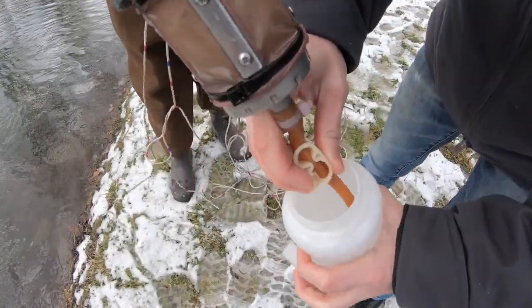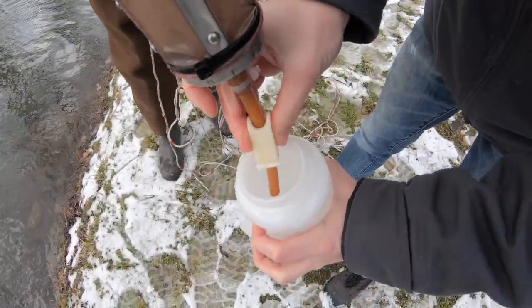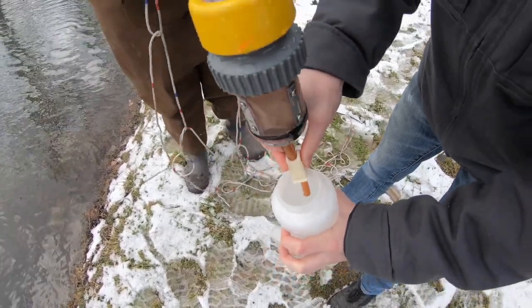Once you collect the plankton, grab a sample jar and open up the clip at the bottom. Make sure to get out all of the sample.